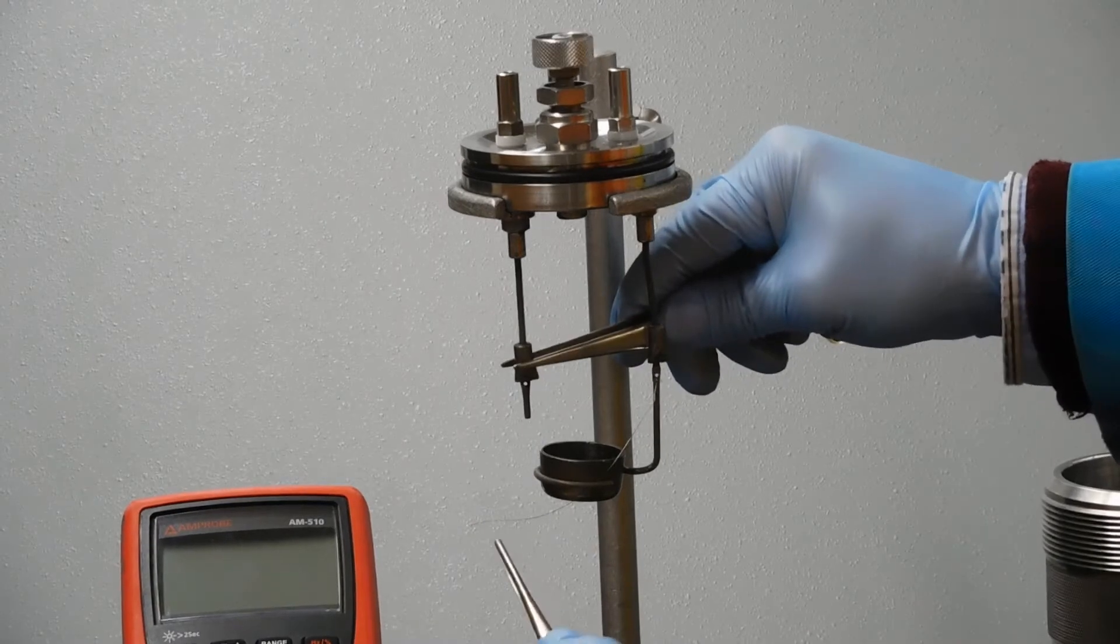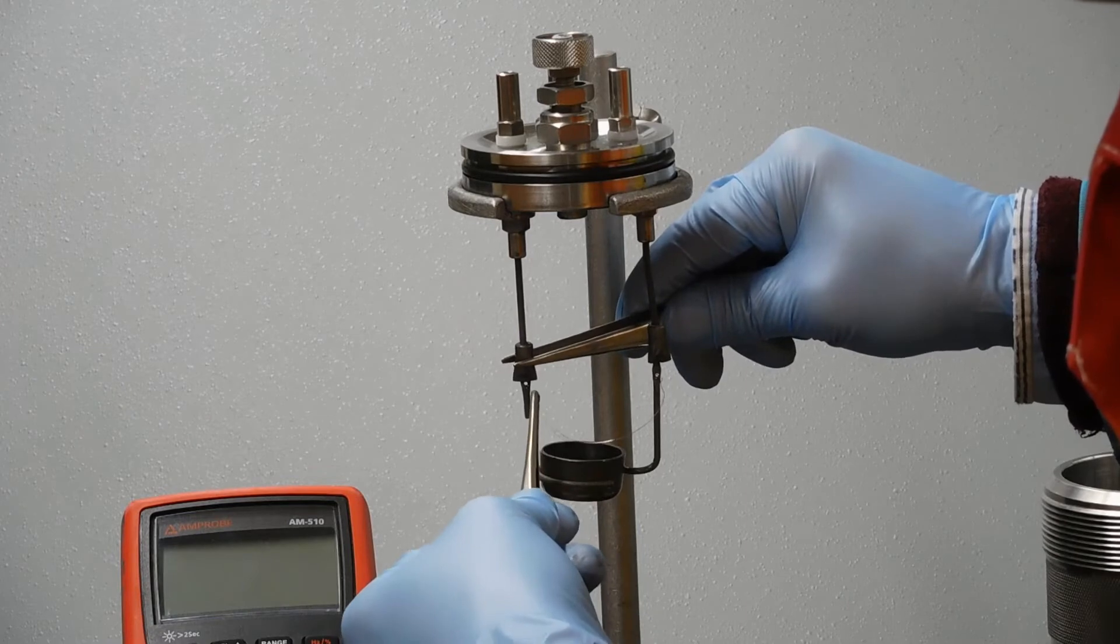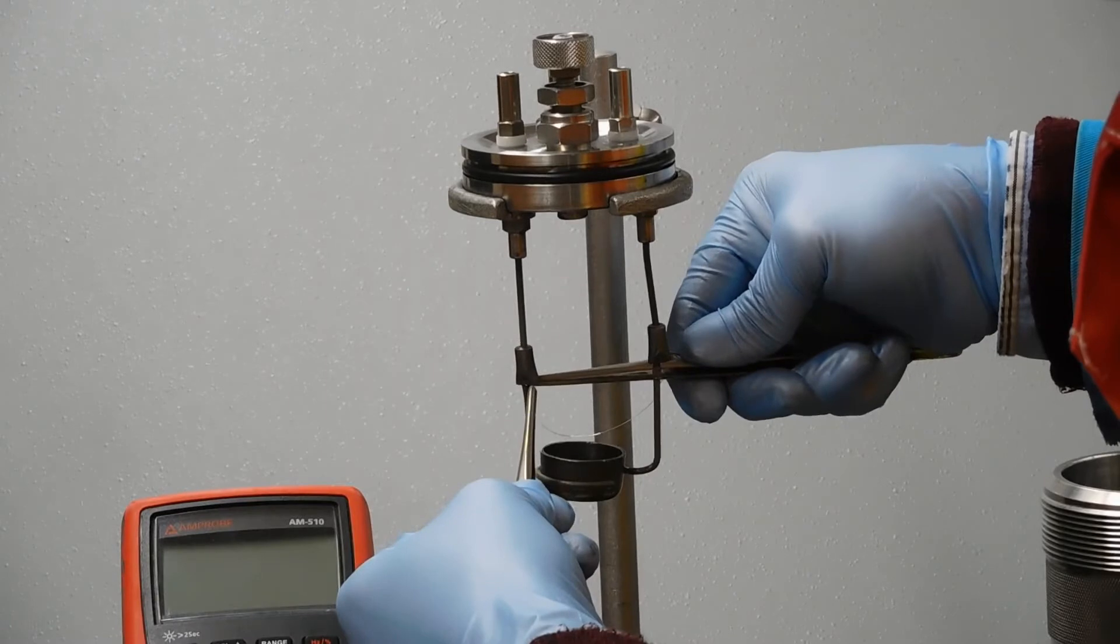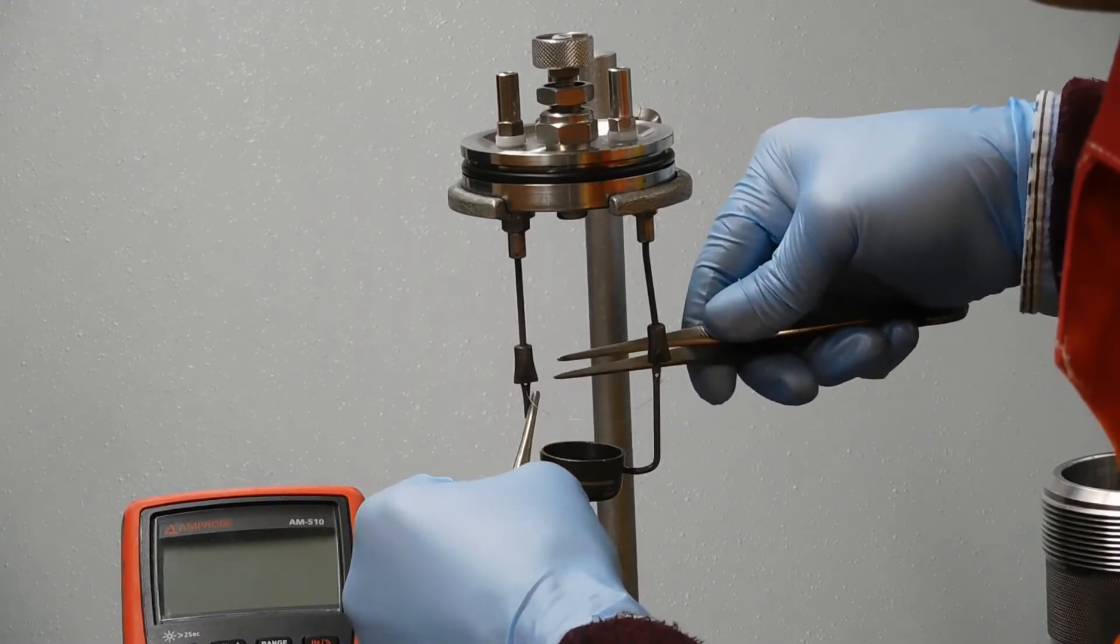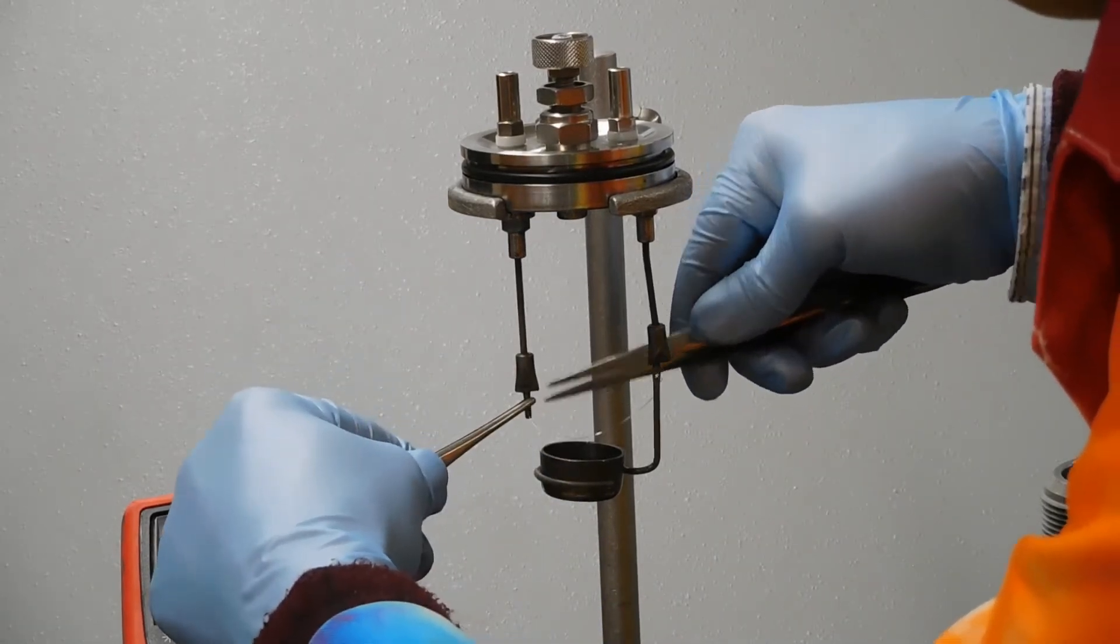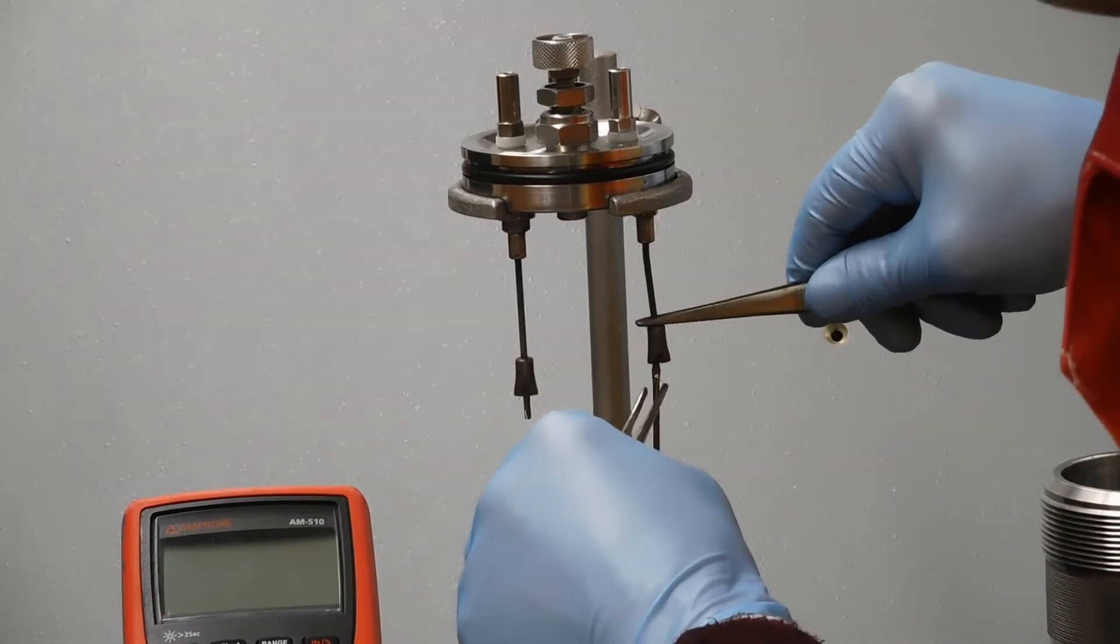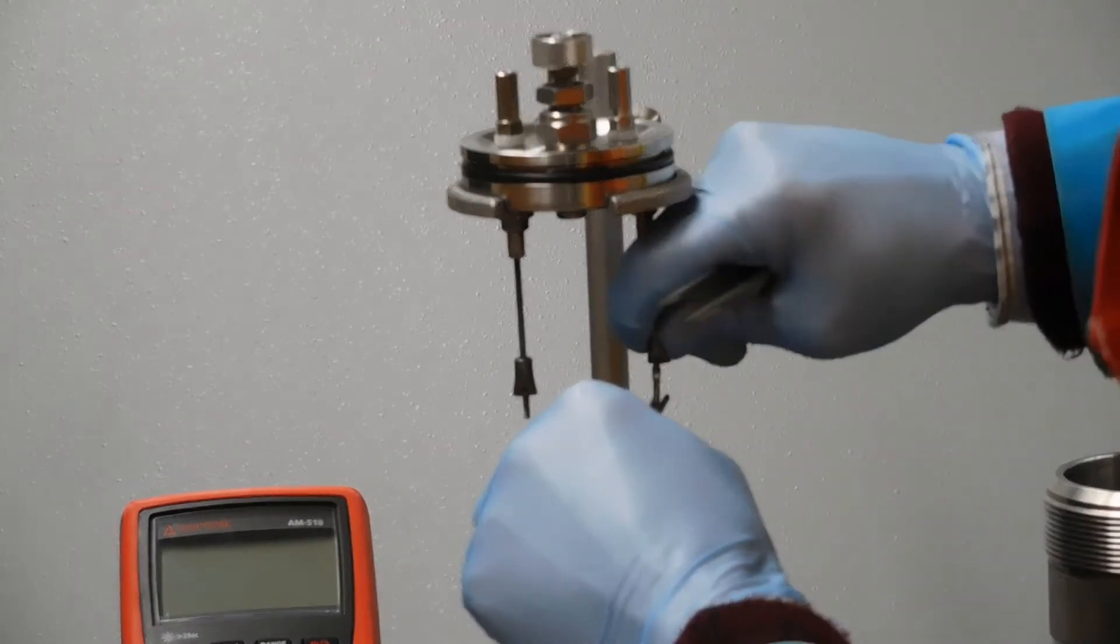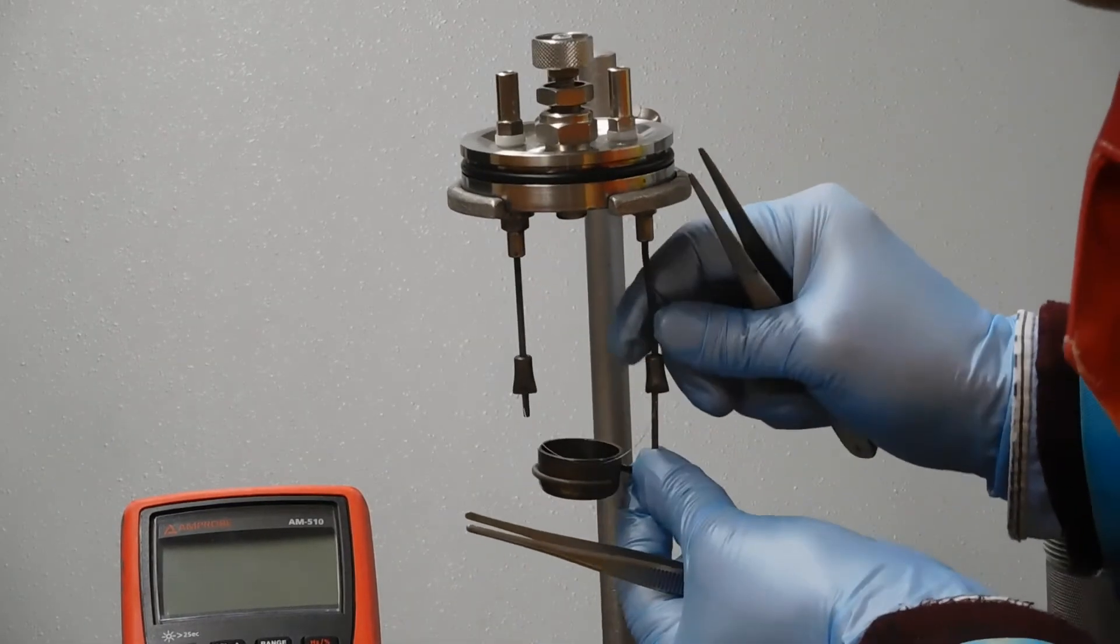Then you can slide these holders down tight on it, and that makes a really good contact.